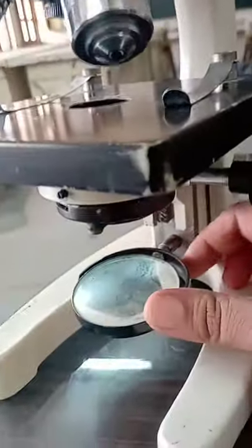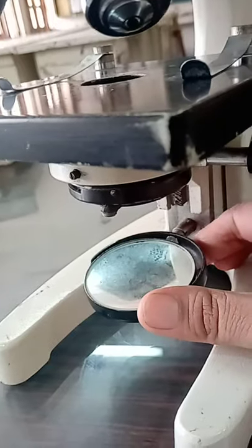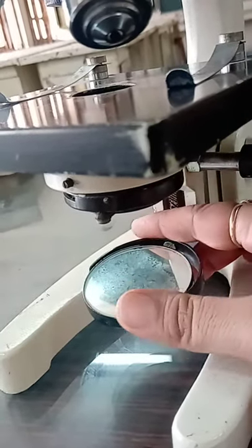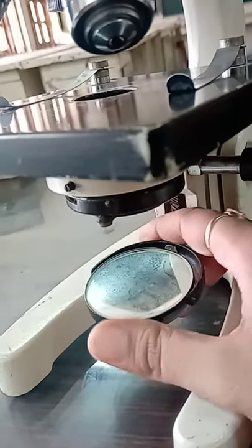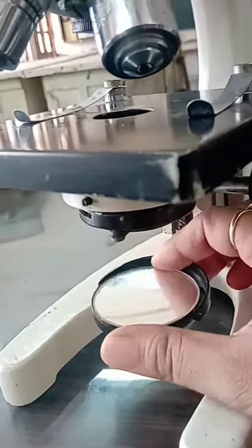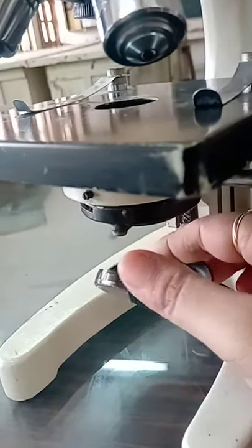Now, the third optical part is the mirror. The mirror collects the light from the source and reflects it upward towards the diaphragm.